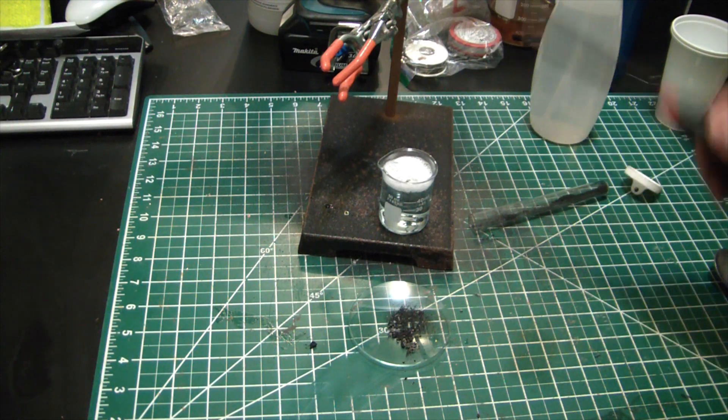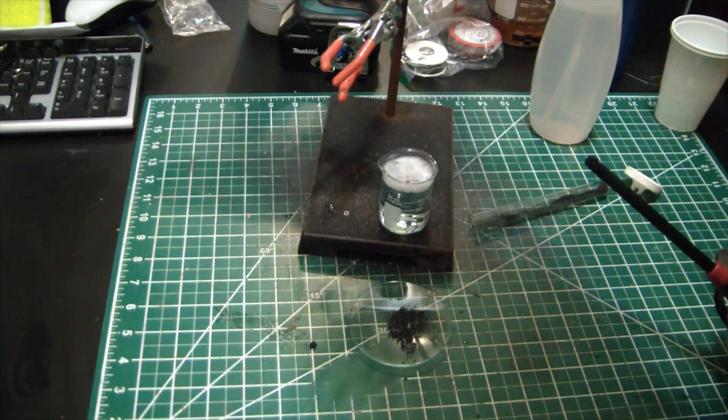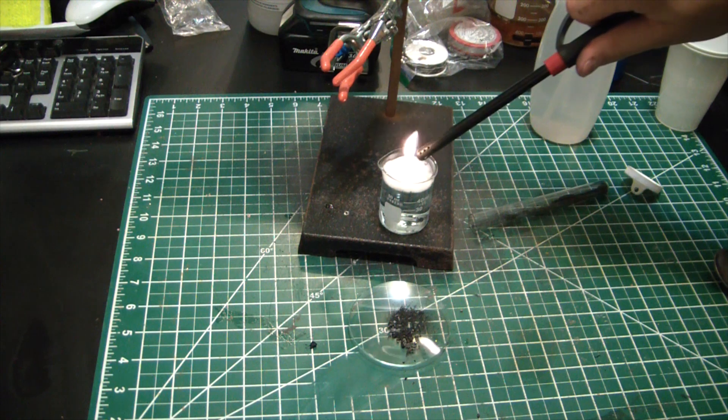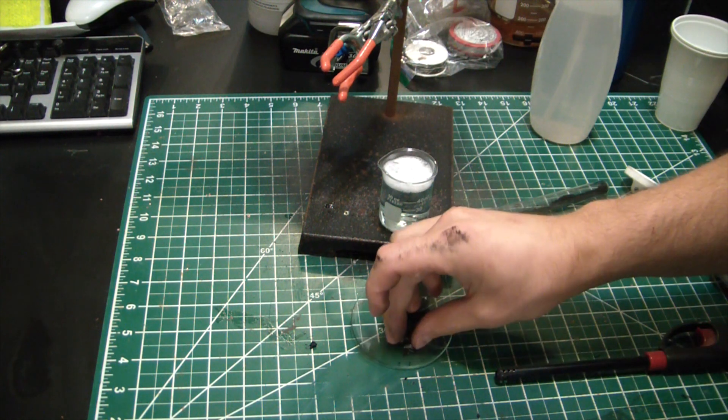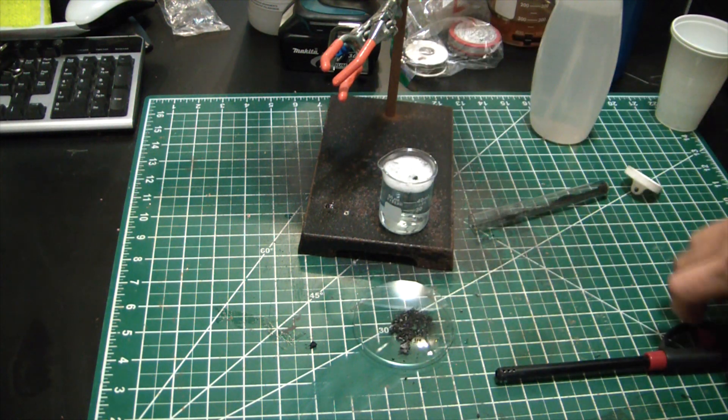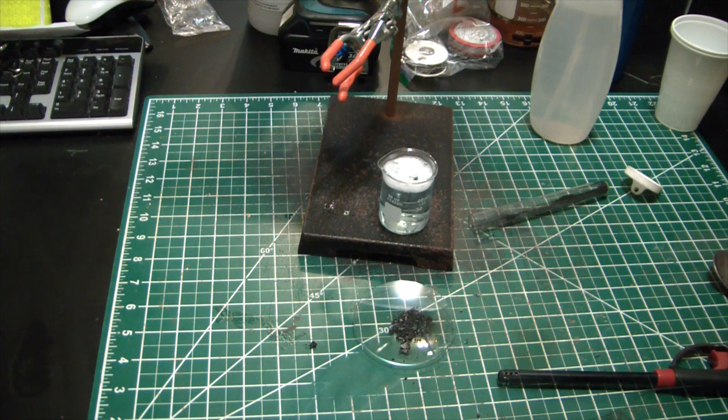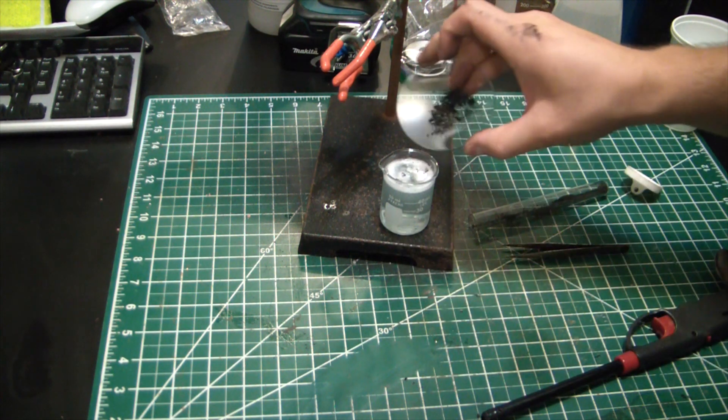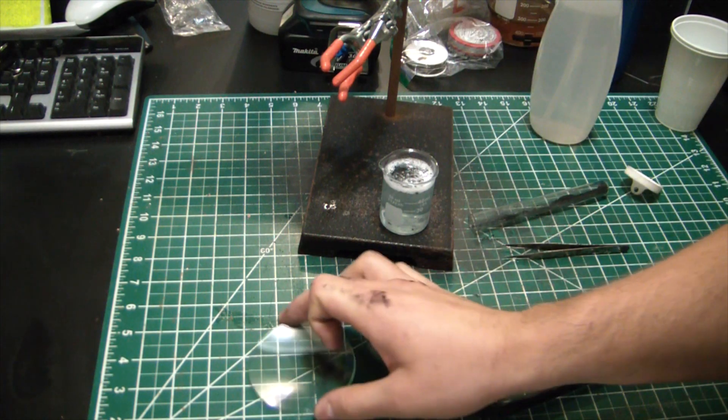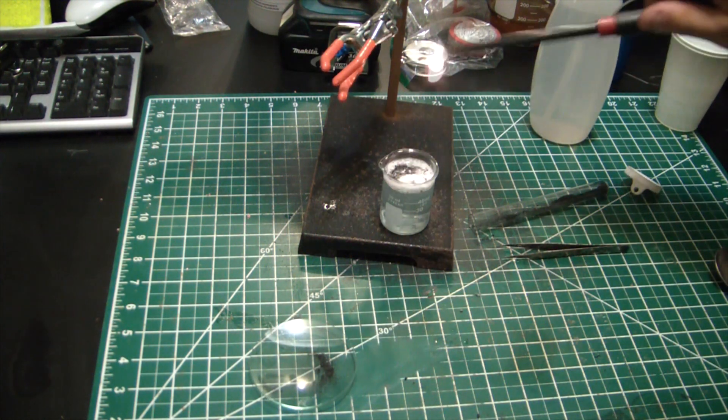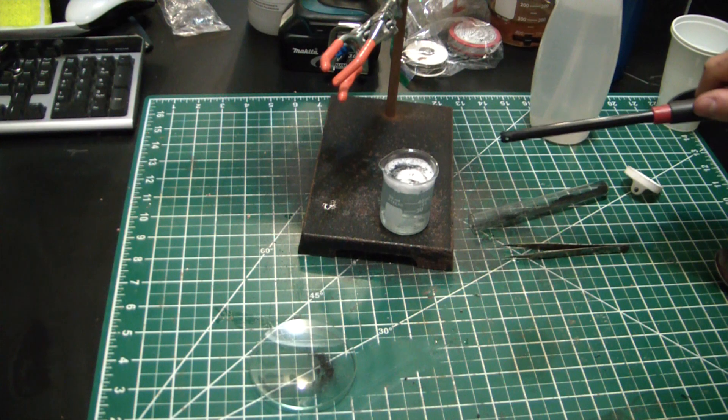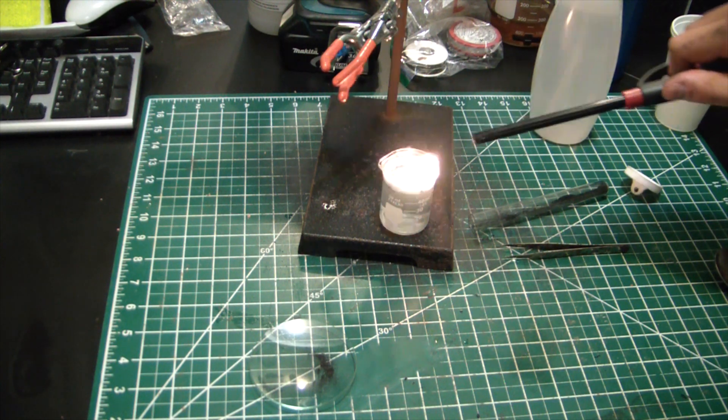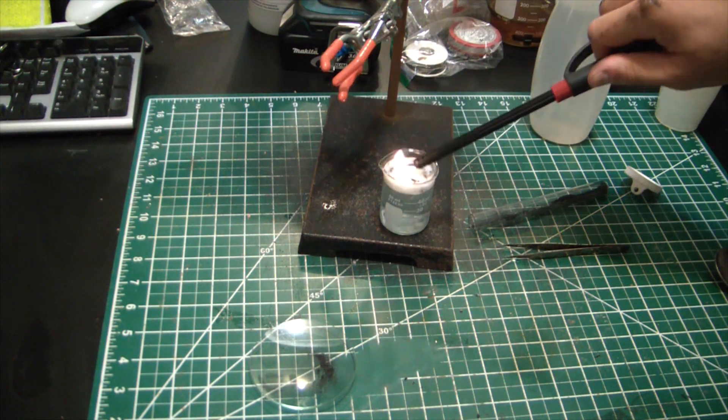That looks like acetylene flame. I'm not seeing a lot of soot. Smells like acetylene. Holy shit, that's amazing! It actually worked! Oh yeah, there's the sooty flame. That is awesome.